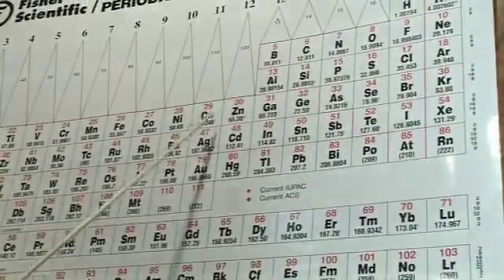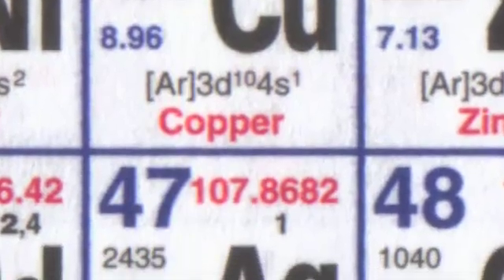What we'd do today is do a competition reaction, and that competition reaction is based on something called the reactivity series of metals. We're going to compare the reactivity of two metals — it's a bit like a game of football. We're going to give one of those metals the football, and in this case it's a salt component called nitrate. The two metals competing for the nitrate are silver and copper, and one of these metals is going to win.